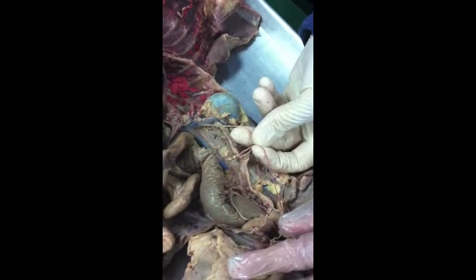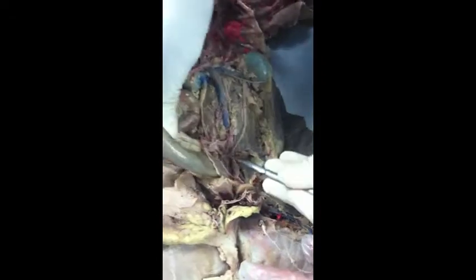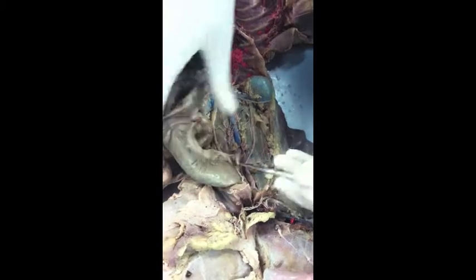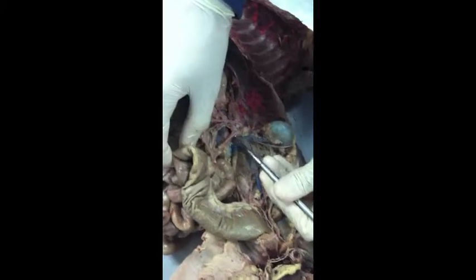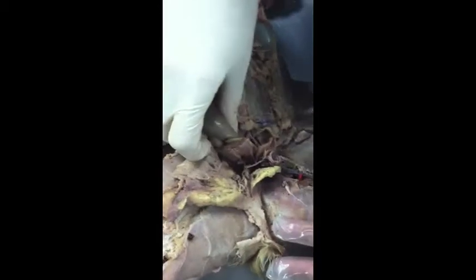Okay. Can we just do the whole thing with you? Let's do the whole bottom half. What else do we have? I'll point to it, you tell me what it is. What is this one again? Inferior mesenteric artery. Tell me what that one is again? Celiac artery. And that one is the superior mesenteric. Exactly. Keep going over those.